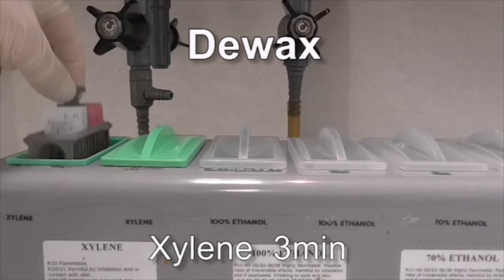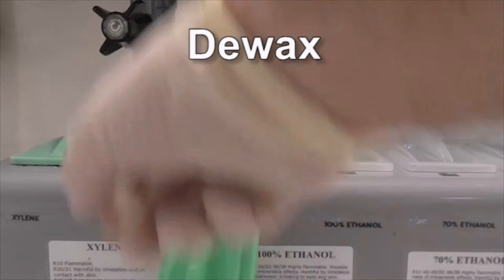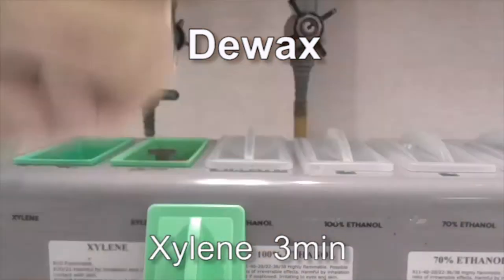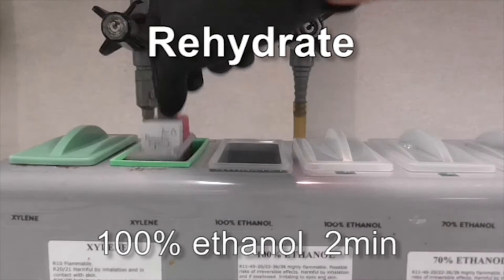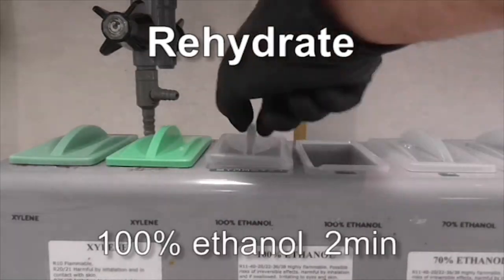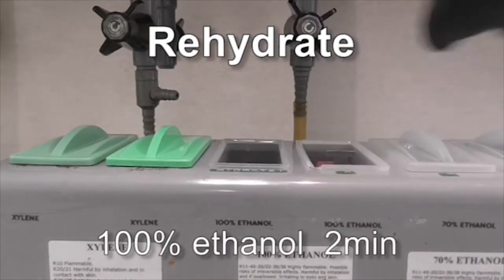Firstly, we need to remove the wax from sections. To do this, we place them in xylene for 3 minutes, then again for a further 3 minutes, followed by 2 minutes in 100% alcohol twice, and 70% ethanol at the end.